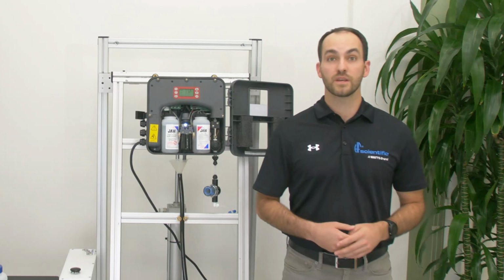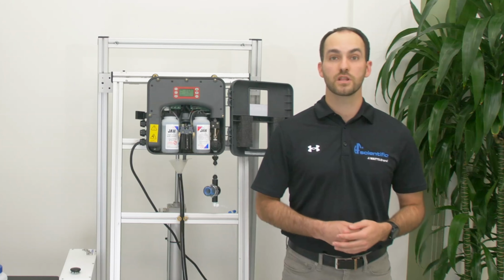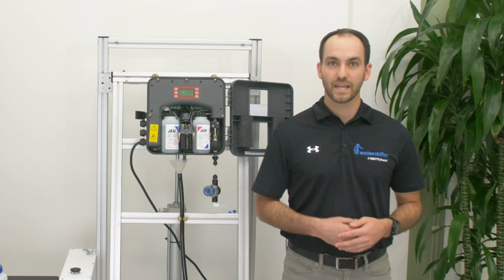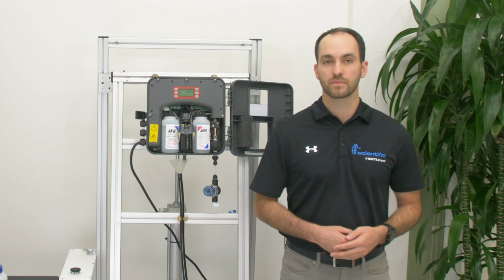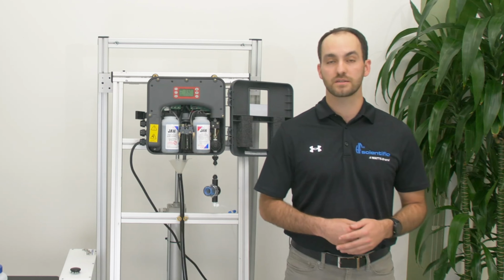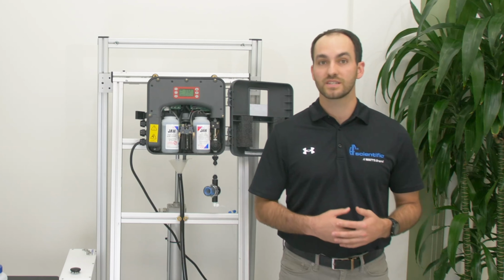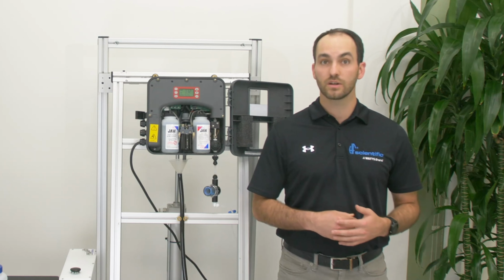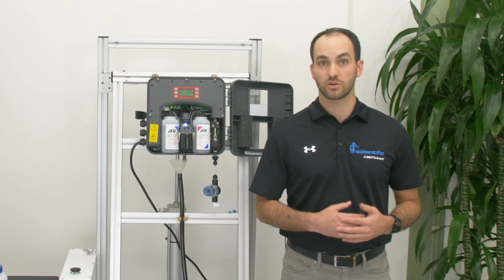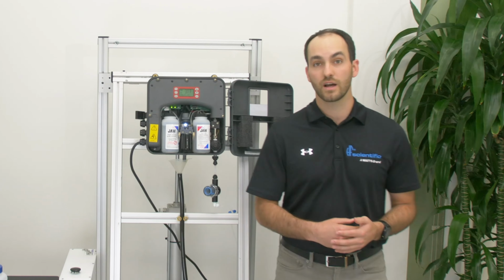WATR, or water, is a common alarm that will be seen with the flow alarm. WATR means the analyzer is not getting any water into the sample chamber. Start by adjusting the regulator to a 10 to 12 on the flow test. If you cannot get enough water to satisfy the flow test, you need to look at blockages in the line before the analyzer. Start by making sure your valves to the analyzer are turned on.